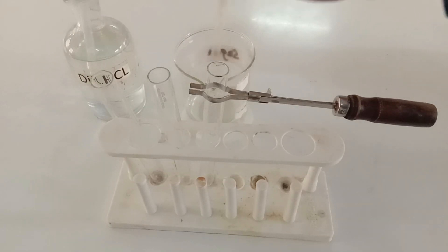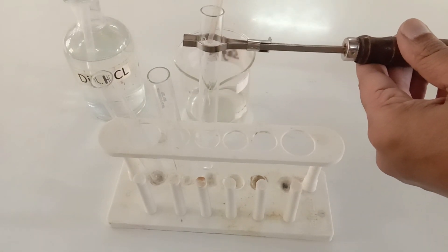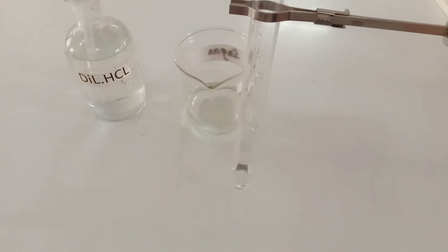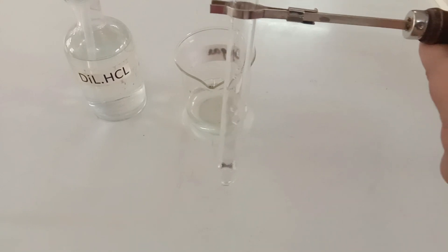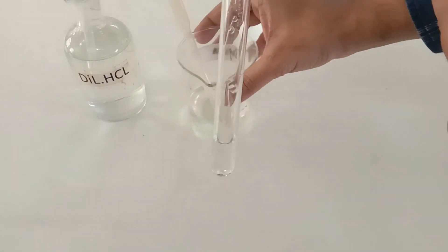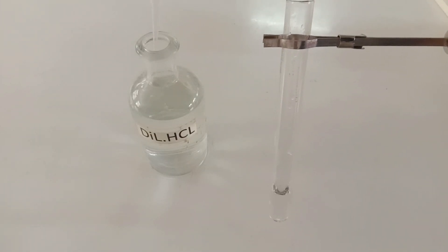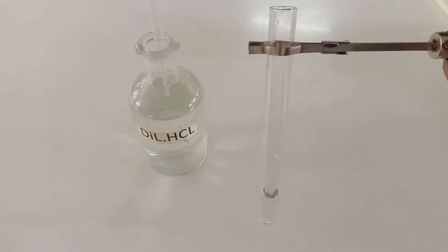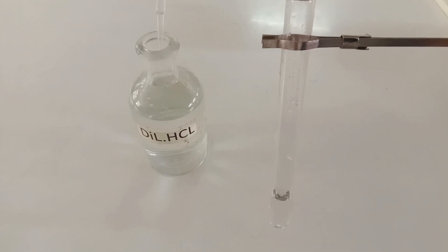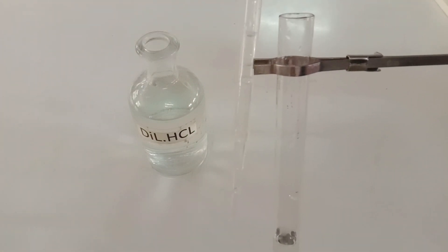First of all, I am going to add about 2 to 3 ml of food solution with the help of a dropper into the test tube. Now I am going to add about 1 ml of dilute hydrochloric acid into the food solution with the help of the dropper. Due to this addition of dilute hydrochloric acid, the food sample turns acidic in nature.